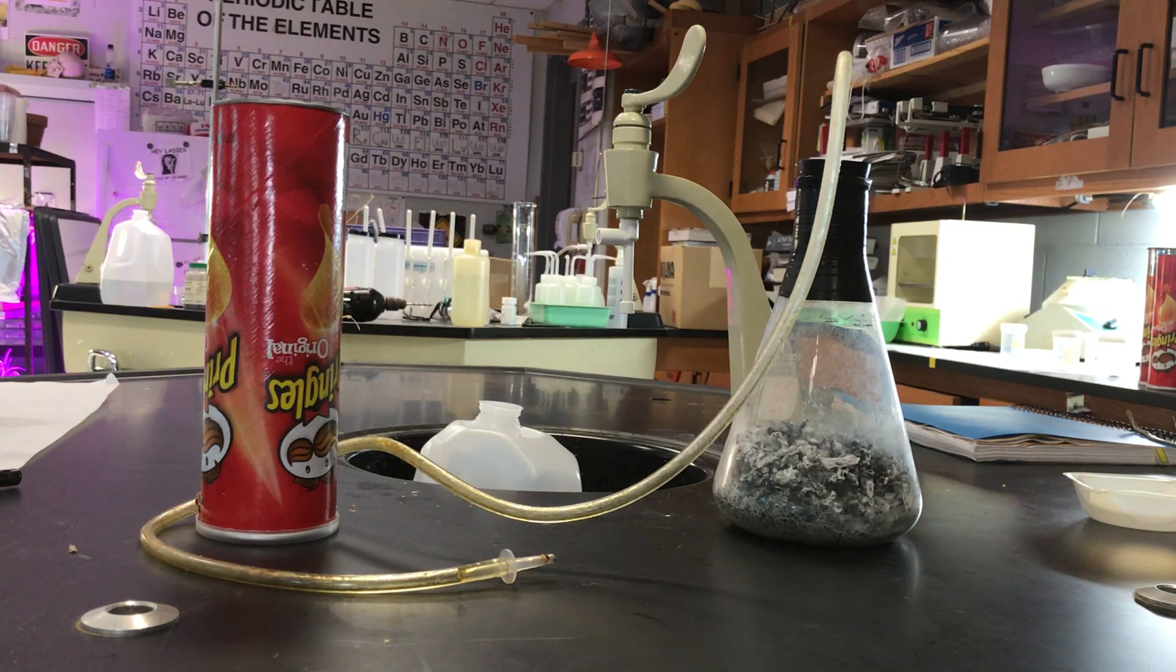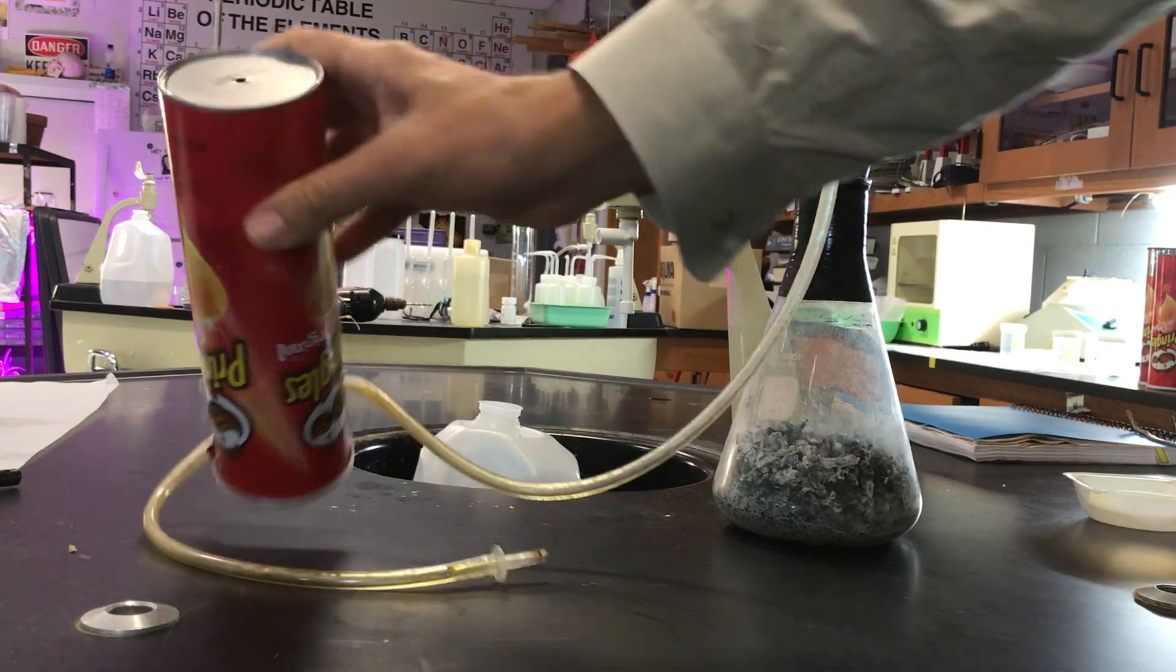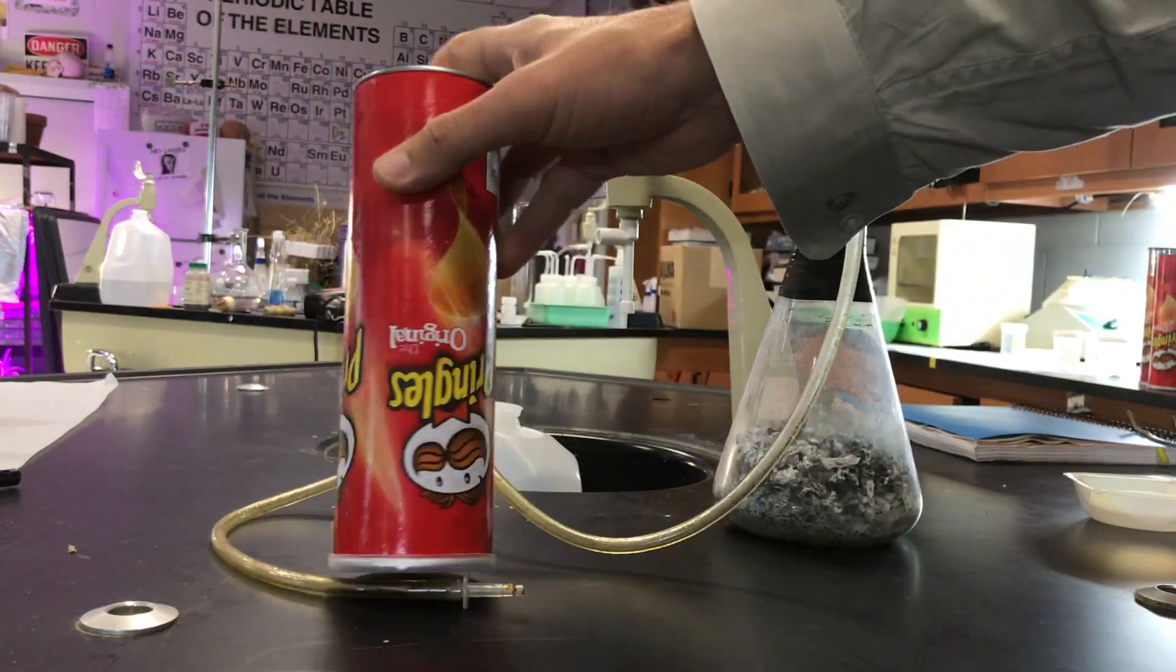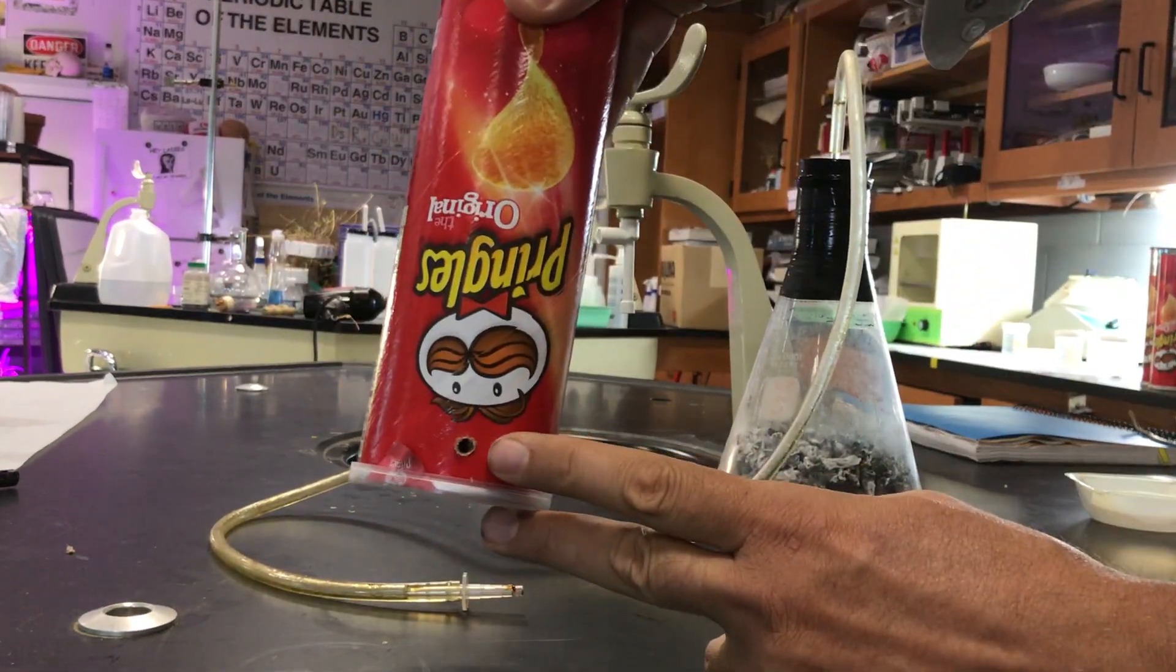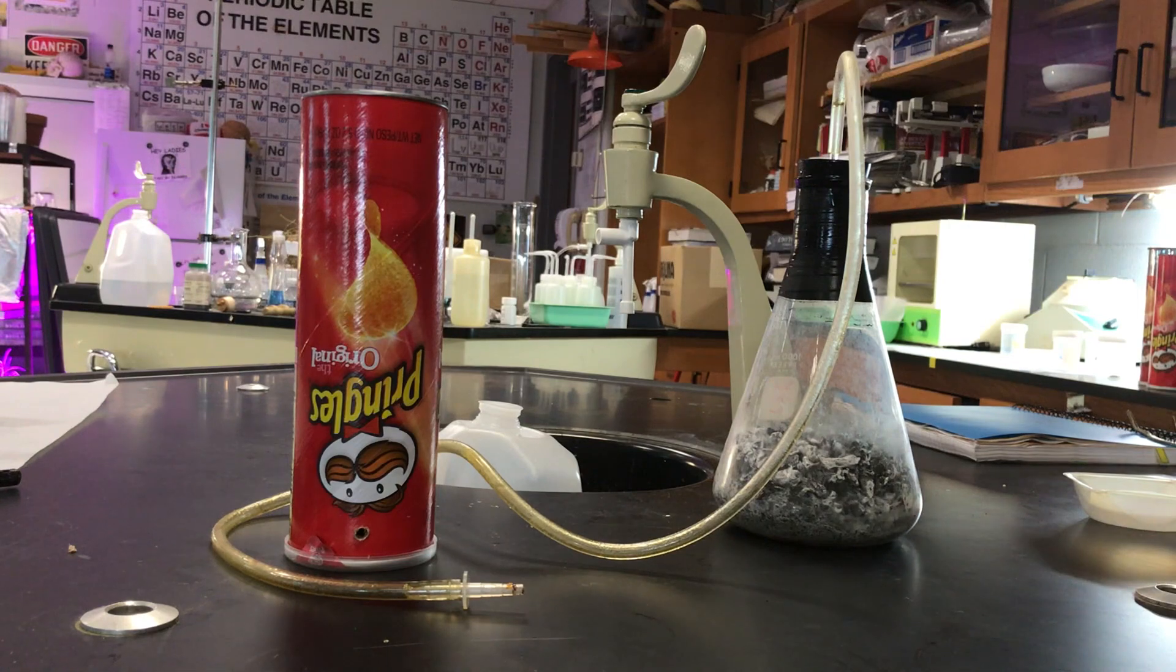Okay party people, I've got a little hole on top of my Pringles can and a little hole on the bottom here. Without further ado, I'm gonna create some hydrogen.